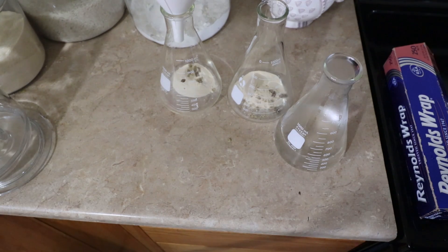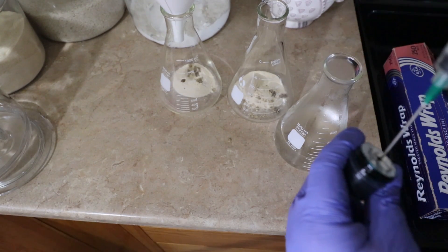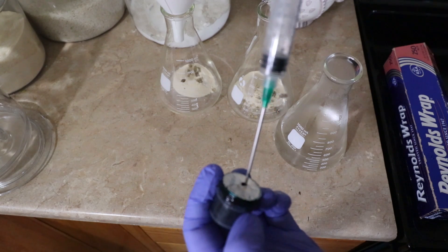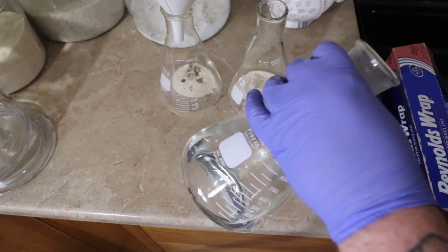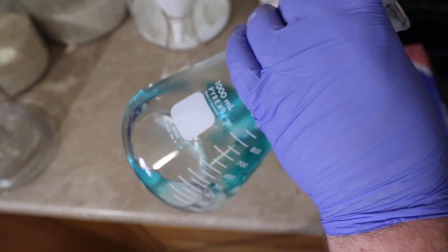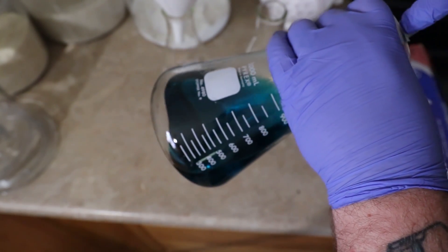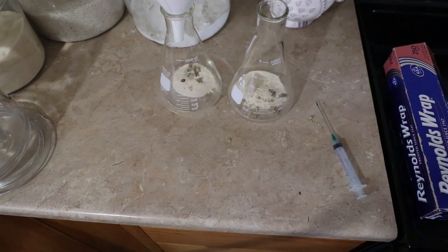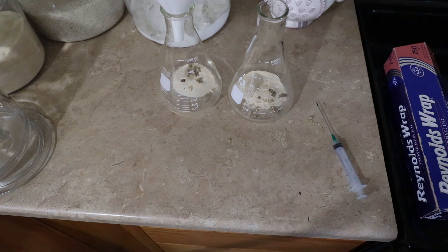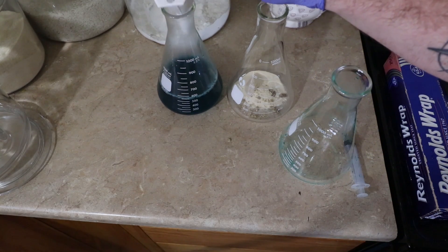Here comes the fun part — today we're using teal food coloring, link down below. I get all this stuff on Amazon. So I filled up a needle and now I'm going to place that right in there, suck up the water — and this is the really fun part — whoosh. There we go. Pretty, pretty. Pour that in — and that's just the hottest water I could get from the tap.